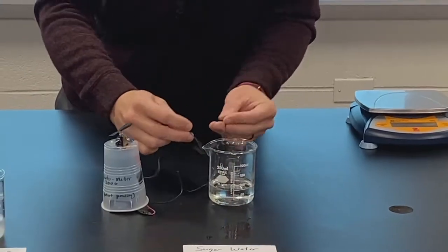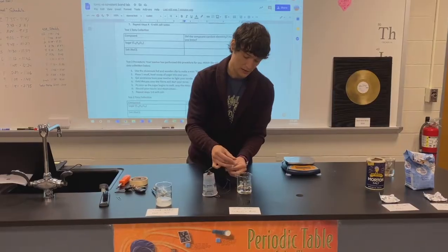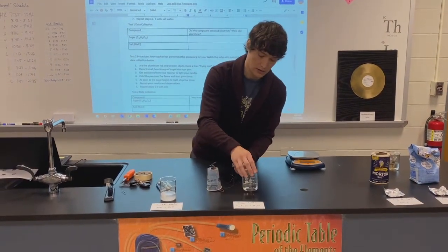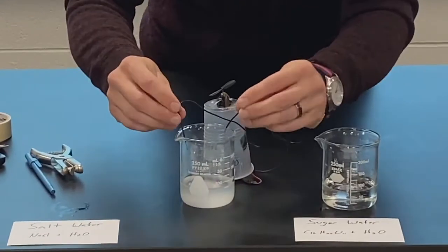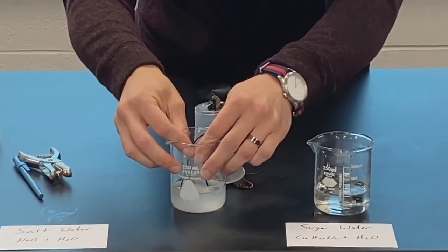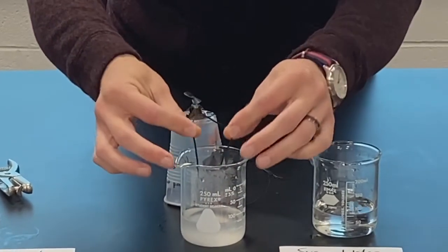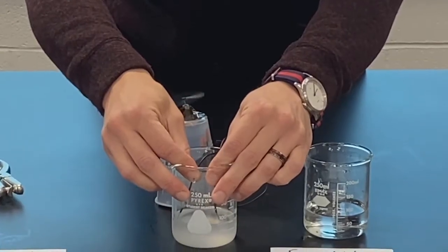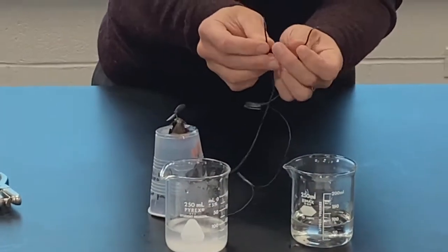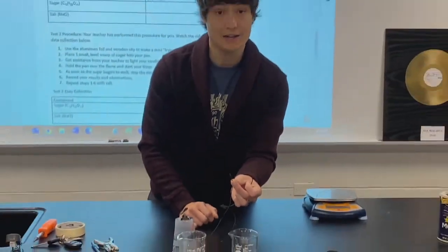And I got nothing — dry. Let's try the salt water. I want you to notice the probes are not touching in the solution. The electrons are flowing through the solution to close the circuit, going through the water to close my circuit. So that is, in fact, conducting electricity.